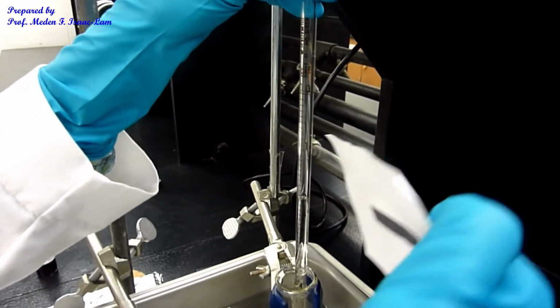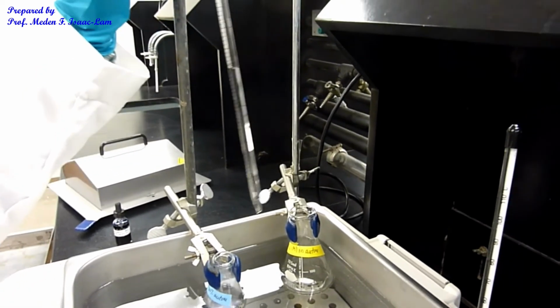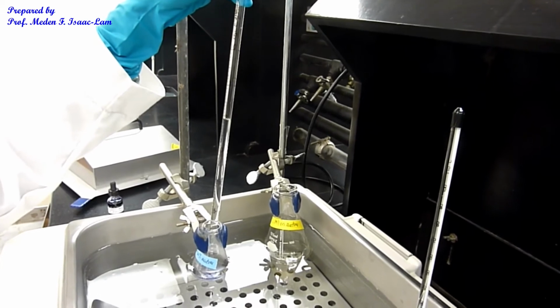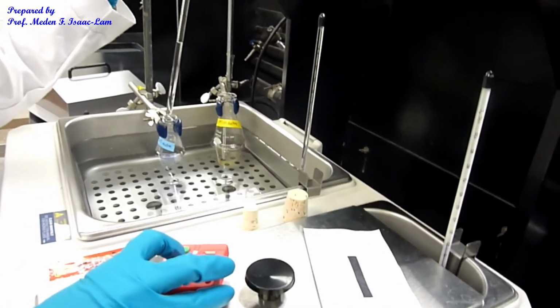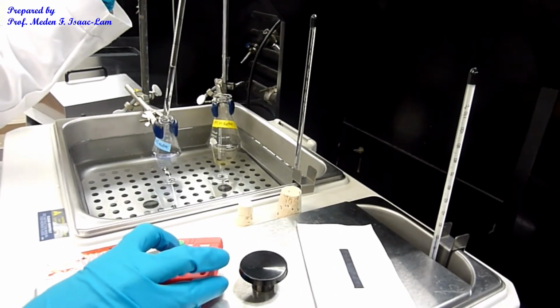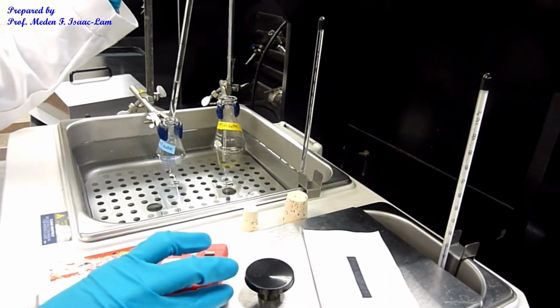Okay. All right. So now, once I deliver about 1.5 ml, I'm going to start timing. So up to about 3.5.